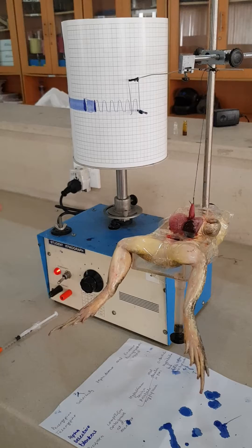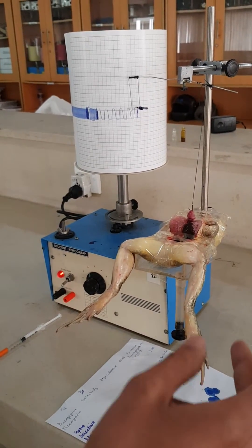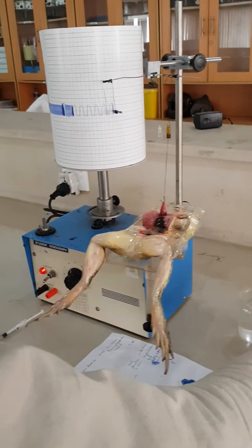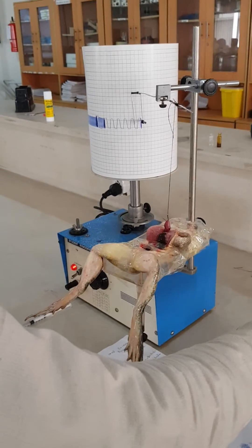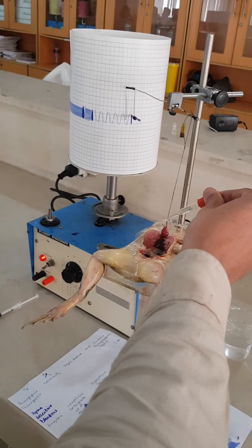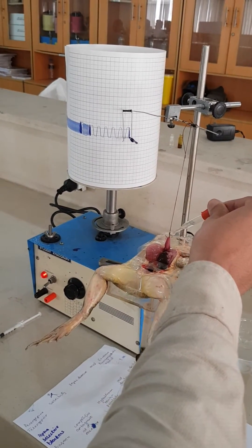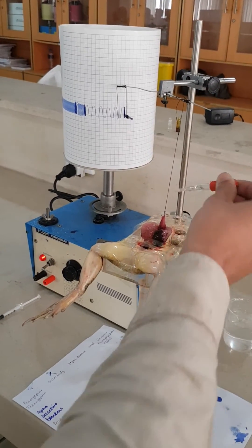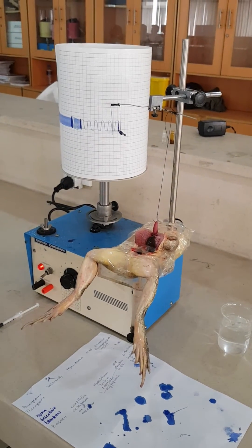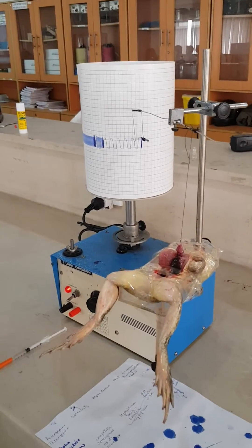After stopping, we need to make a solution and wash the heart with it. We wash it using 2-3 droppers so that the effect of the first drug is cleared, and we can apply the new drug.